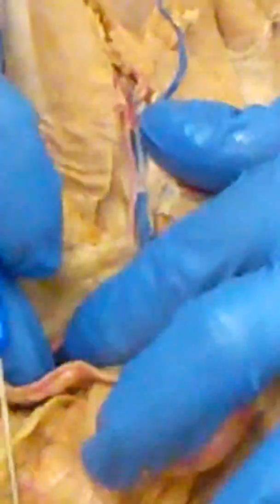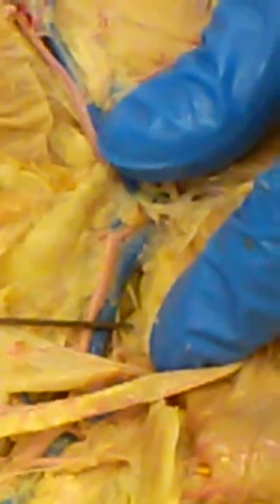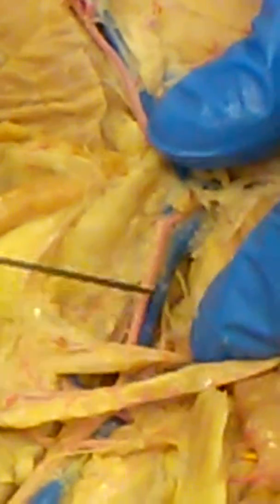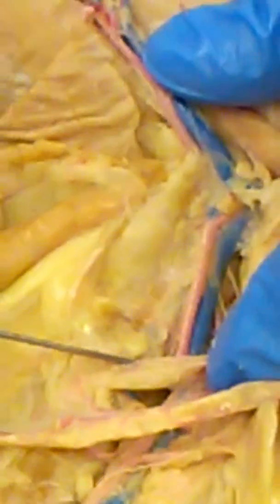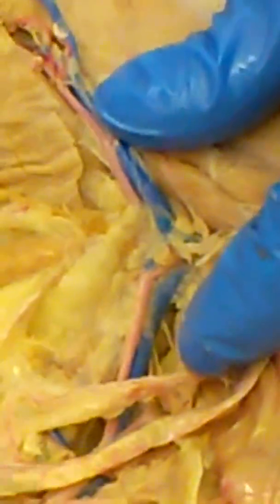When we get in this area, it gets a little tricky because these are your iliac veins, the blue veins. In a lower segment here, they're called your external iliac veins. There is a branch here, you don't need to know this, but there's a branch which is kind of the landmark of the internal iliac vein. And anything above the internal iliac vein, what we call the external iliac vein, becomes the common iliac vein. Everyone good with that? Okay. Yep. We're going to move on up.